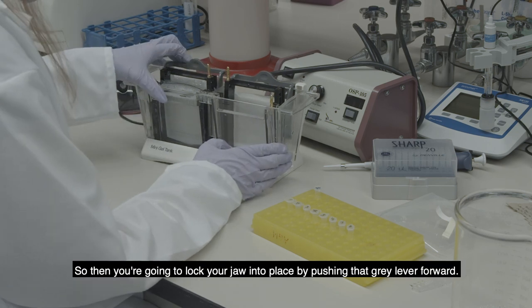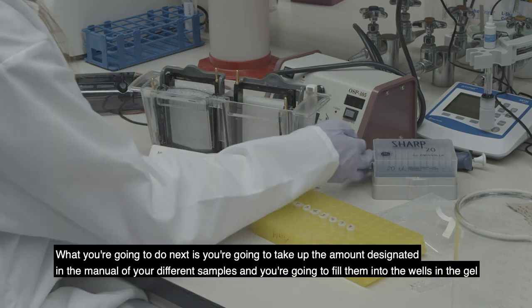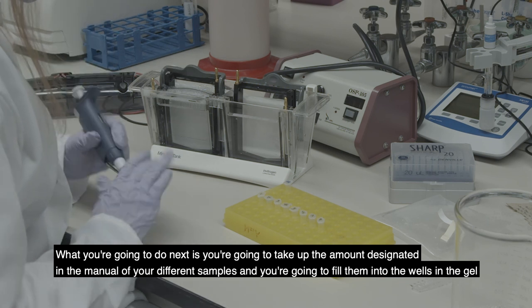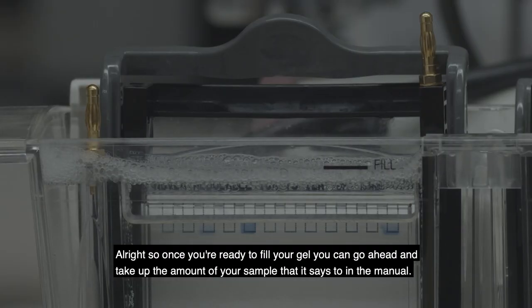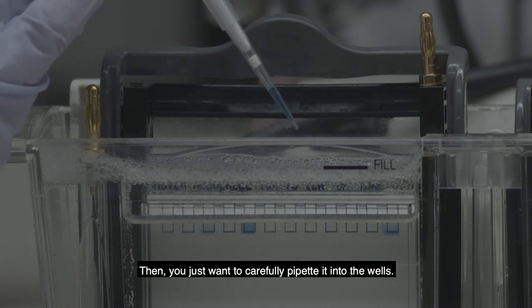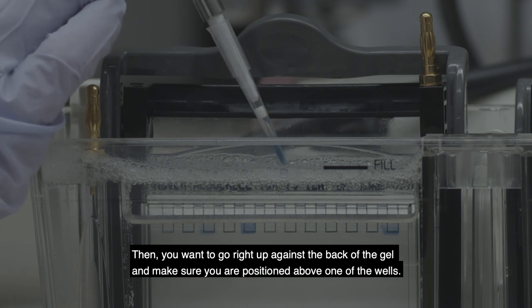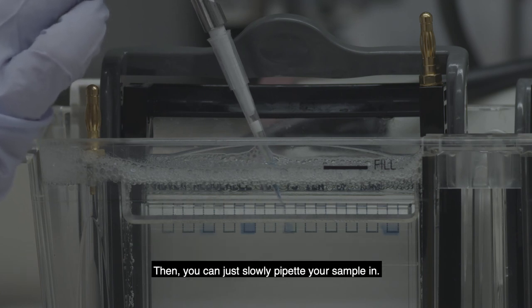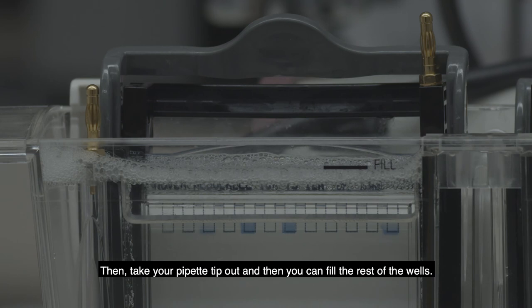Lock your gel into place by pushing the gray lever forward. Then take up the amount designated in the manual of your different samples and fill them into the wells in the gel, just as we did previously. Once you're ready, take up the correct amount of your sample, stabilize your pipette with one hand holding it with the other, go right up against the back of the gel, make sure you're positioned above one of the wells, and then slowly pipette your sample in. Take your pipette out and fill the rest of the wells.